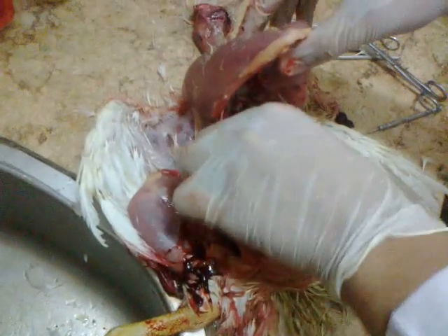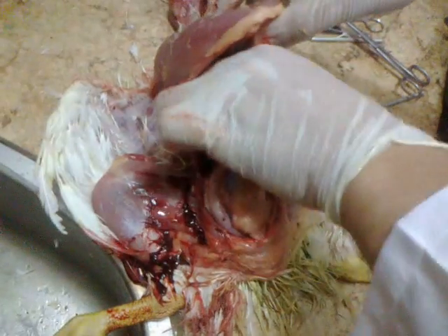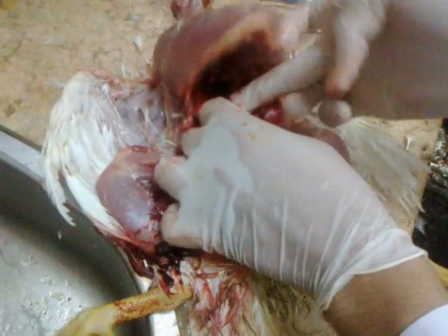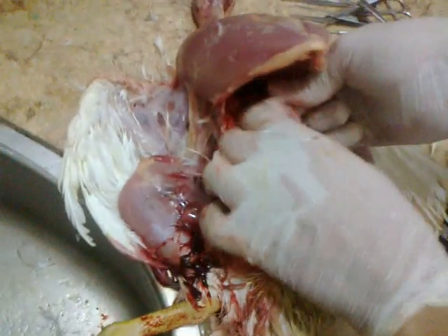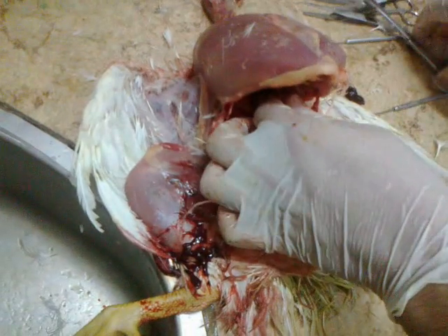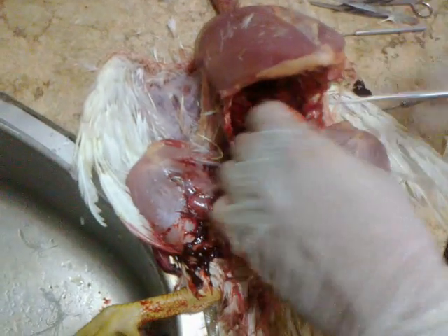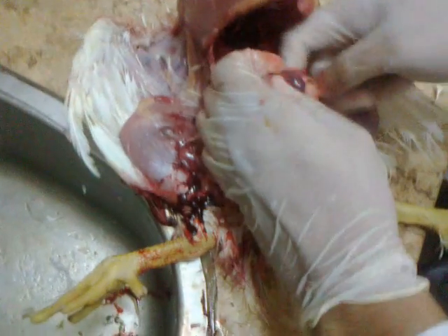In the field here we can see the gizzard-like stomach. We start to detach it from its origin here, so as not to cause contamination of the field with the contents it already has.